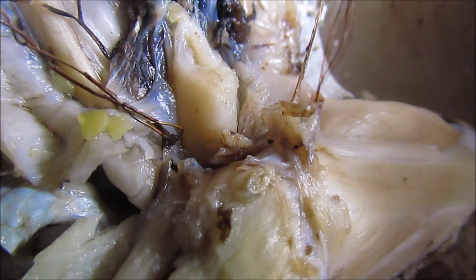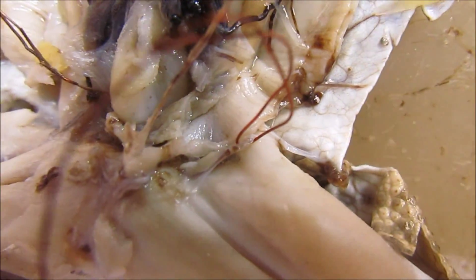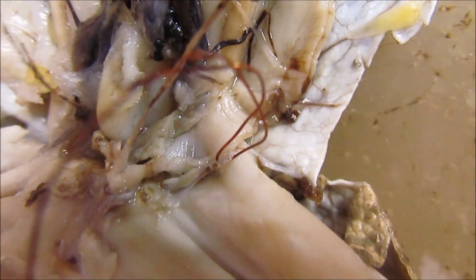This one is the pelvic vein. With the femoral vein, you look at the upper vein — open the muscles.